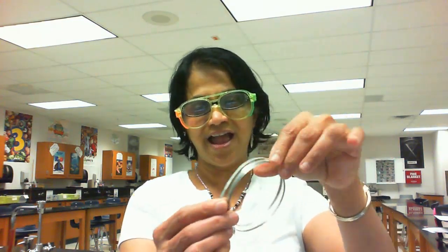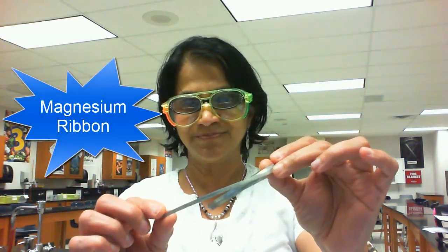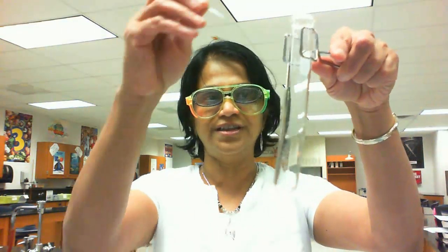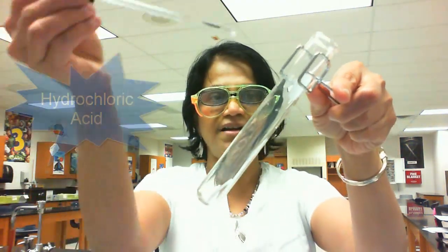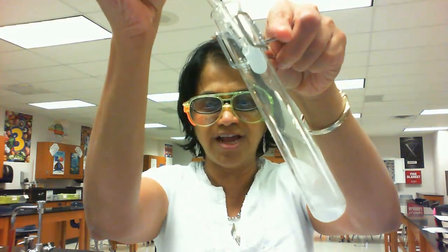Here is the second reaction we are going to begin with, and we have, let me show here, a beautiful shining magnesium ribbon. We are going to take a piece of that ribbon, and let me show it here. This is a small piece, and we are going to do a chemical reaction on that. So here you go. I put that piece in the test tube, and to that I am going to add hydrochloric acid. So let me tell you what I have here. I'm adding hydrochloric acid, and oh, look what happened.